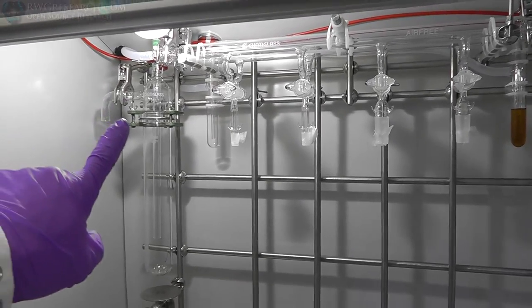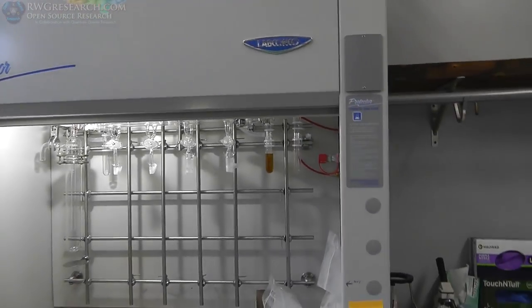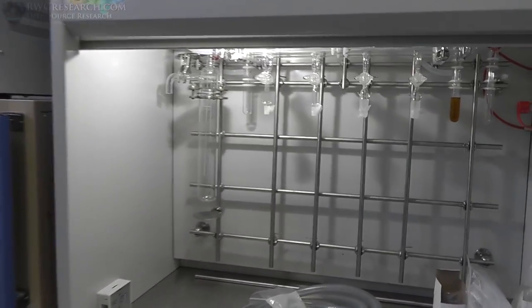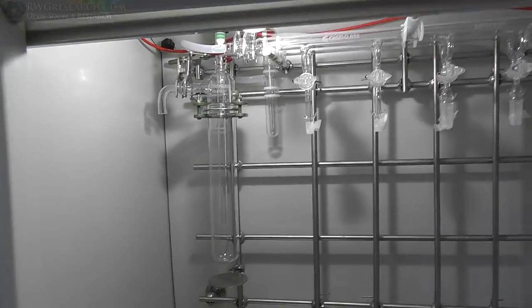Okay, so I forgot to mention two more things. That is, one, I replaced a light. That original light was designed for a hazardous location, along with this entire hood, actually. So we're not using it in that environment, so it's okay to put the light in there like I got it. So I just put a regular light in there, nothing fancy.